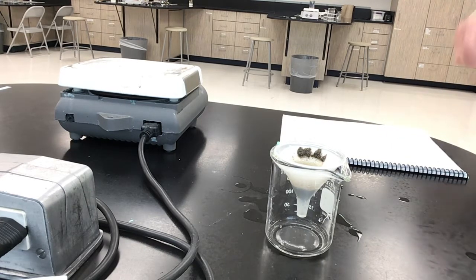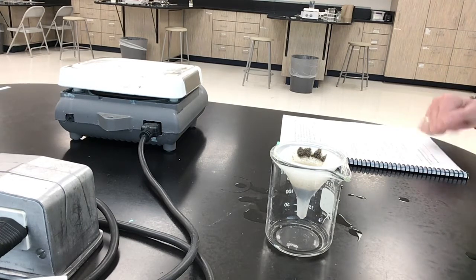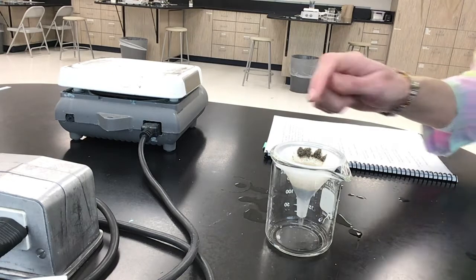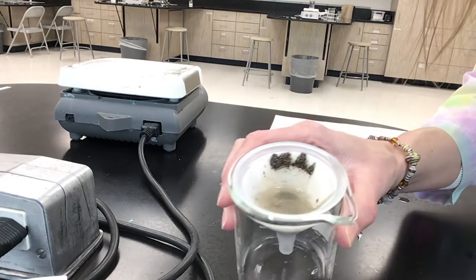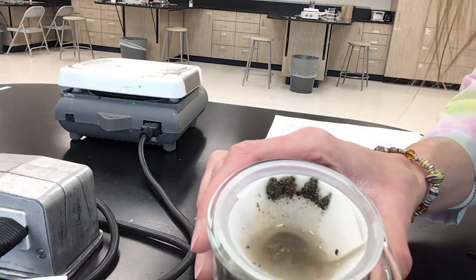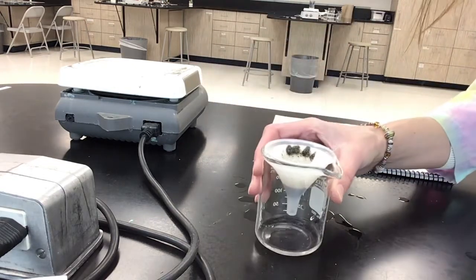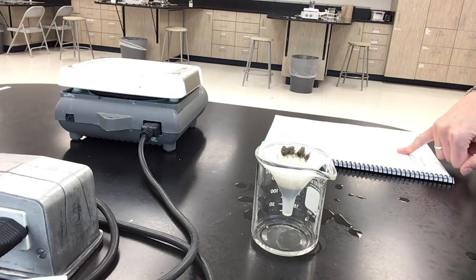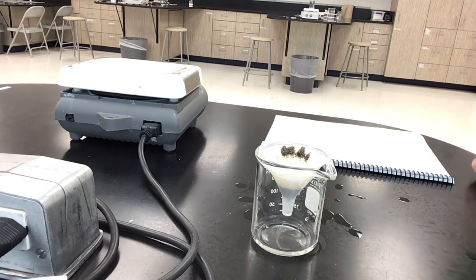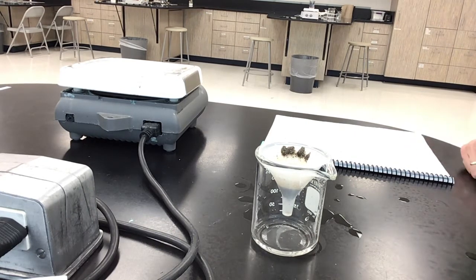We've used not a paper towel, we've used a filter at this point and a funnel. And so we're going to talk about, and maybe just problem solve here, what's left in the filter right there. You guys can see it hopefully, right? What's left in the filter, and you can see it filtering out down there, and what it's dropping is clear down there at the bottom. So it's looking at filtering out. So, predict for me, what do you think is left in the filter, and then what is left in the beaker? And what type of mixture is in the beaker?